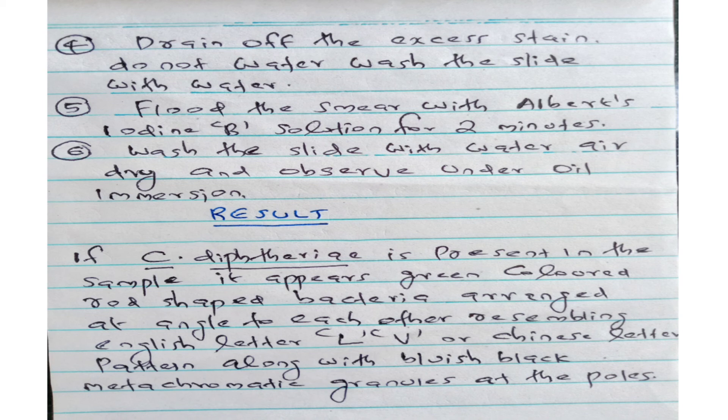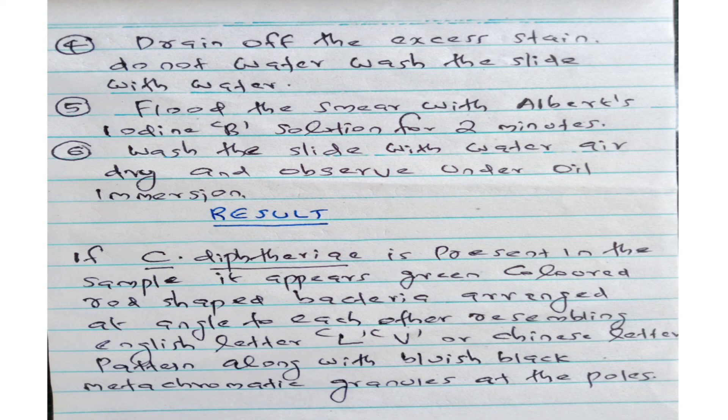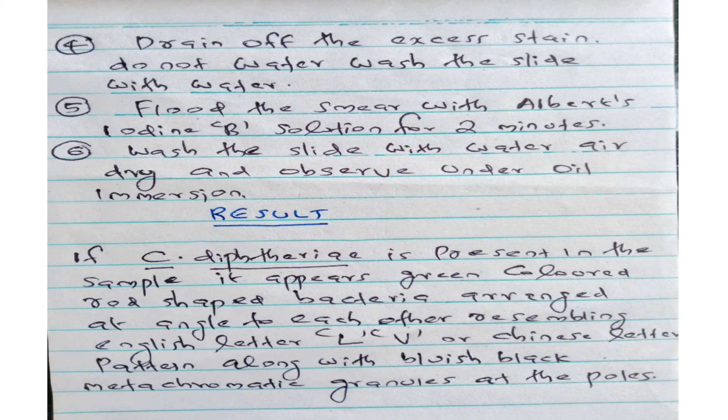Flood the smear with Albert's iodine B solution for 2 minutes. Then wash the slide with water, air dry, and observe under oil immersion objective.